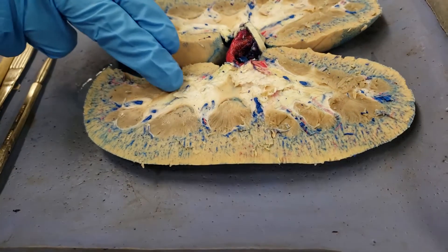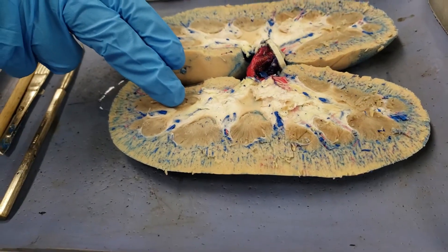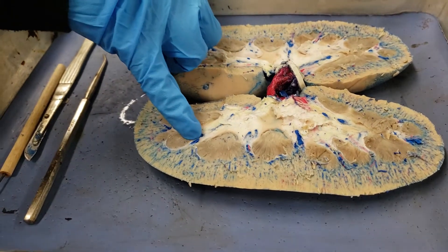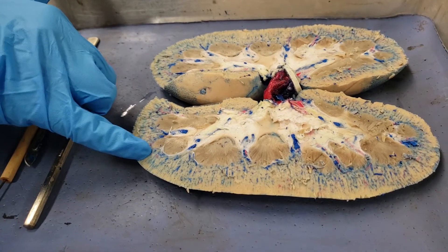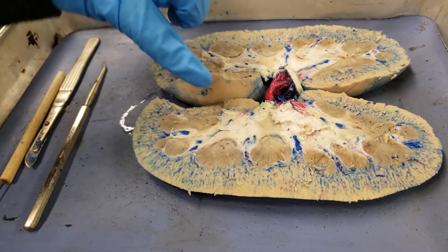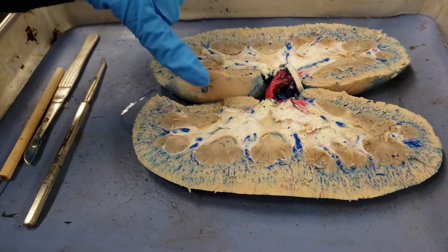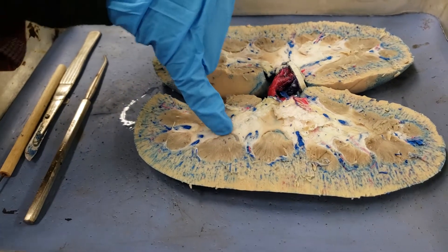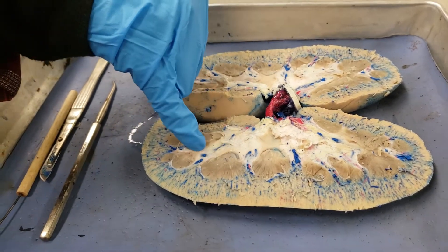We have the pyramids — the pyramids are in the medulla. If asked for a region, we say medulla. If it's out here it's cortex; for structure, it would be pyramid. And then the minor calyx — here's a minor calyx, anywhere really close to the pyramid.